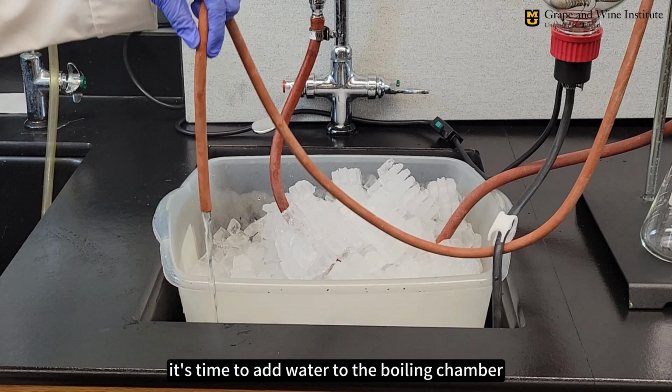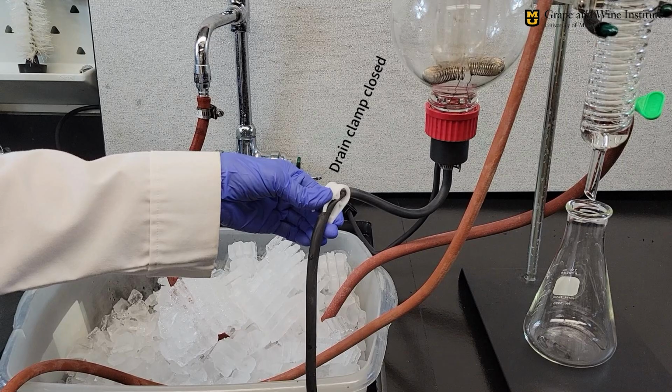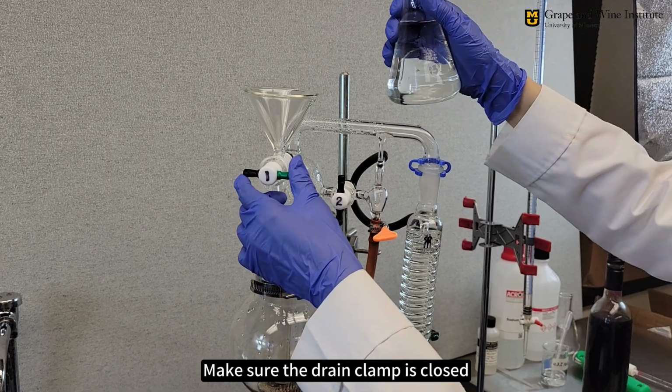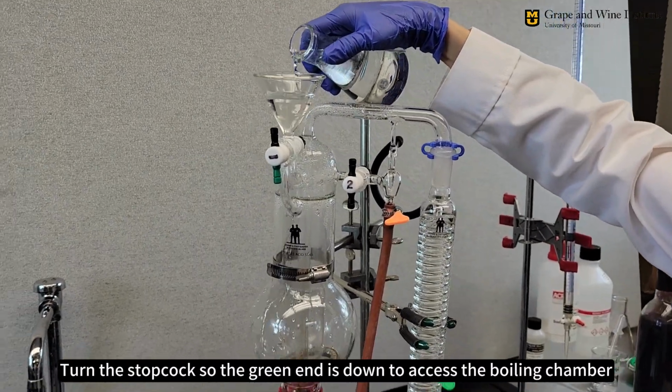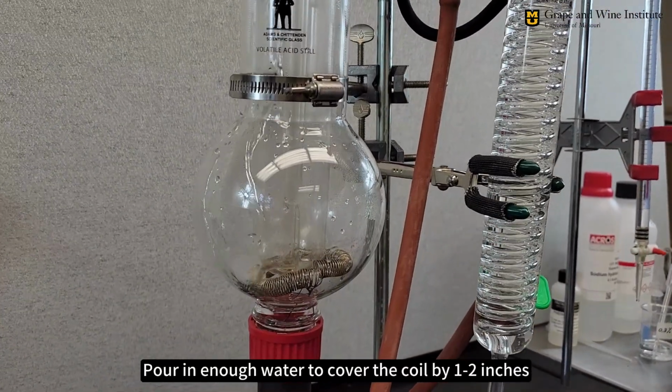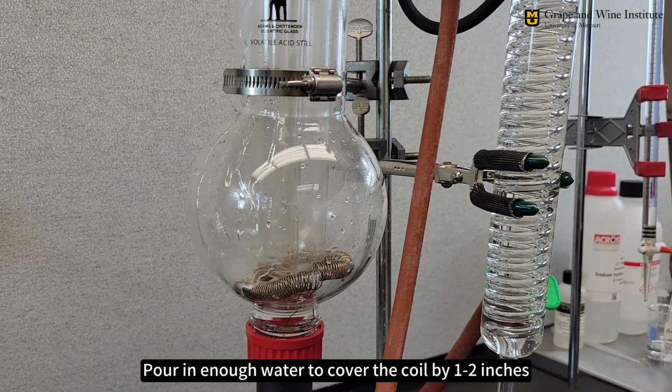Now it's time to add water to the boiling chamber. Make sure the drain clamp is closed. Turn the stopcock so the green end is down to access the boiling chamber. Pour in enough water to cover the coil by 1 to 2 inches.